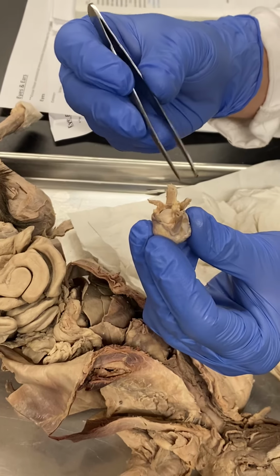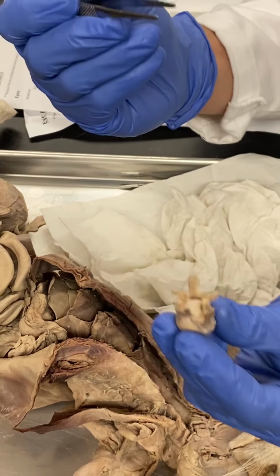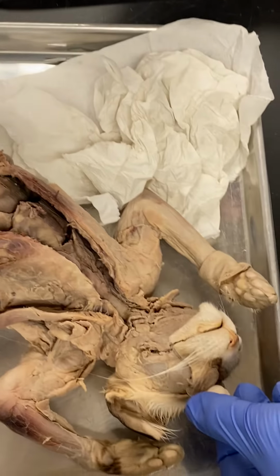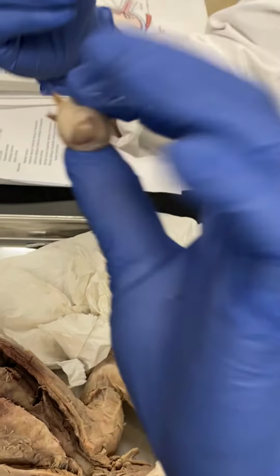And again, this makes it the left eye if you get the dorsal muscles on top, because it would orient like this in the cat. Okay? See what I did there? Adios.